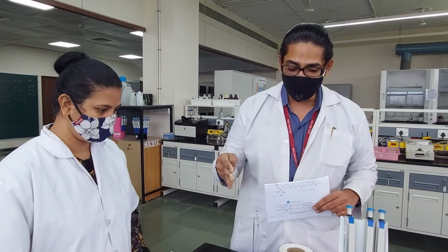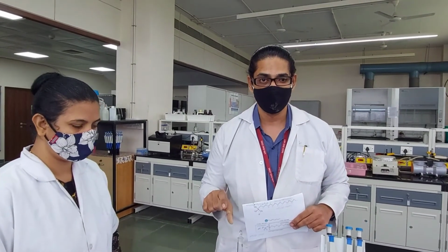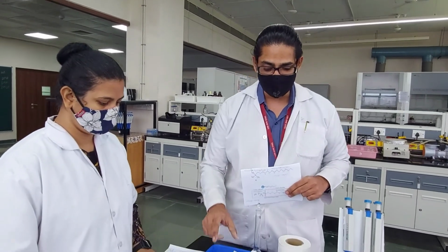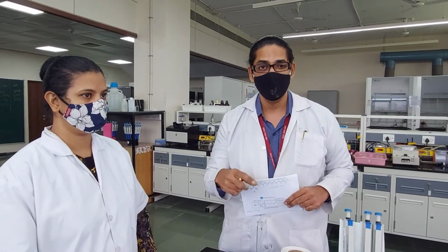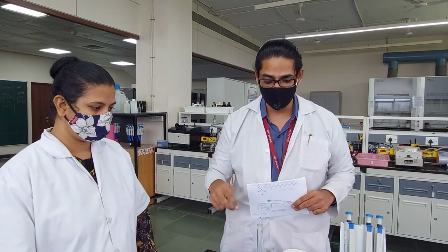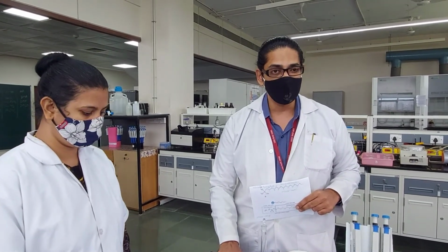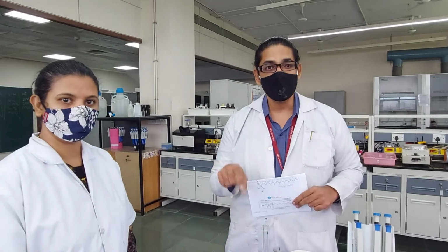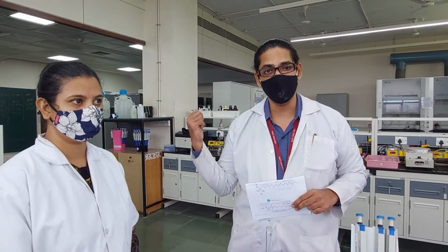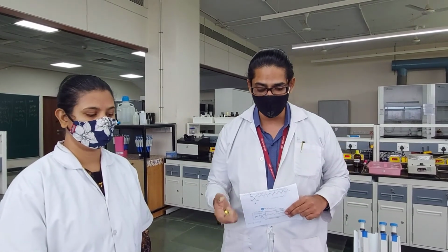Now for the salt effect, our reaction volume for all the experiments will be 50 milliliters. To this we are going to add 200 ppm of any salt, and then titrate in our detergent, which is 0.05 molar. We are going to add 1 ml at a time, up to 15 milliliters, and measure the conductance after every milliliter. It's a very simple experiment, not complicated at all. Then we will see if any of those ions we added shift the CMC value for the 3 detergents we are going to see.